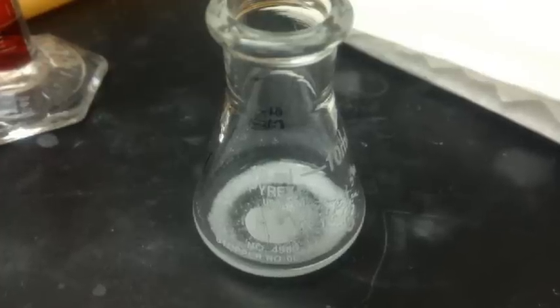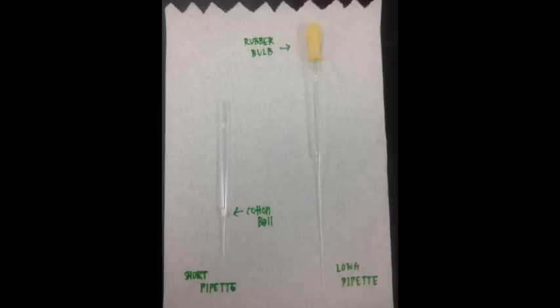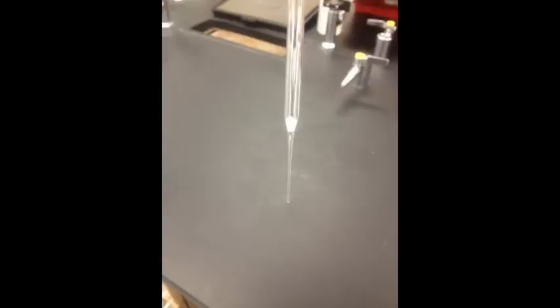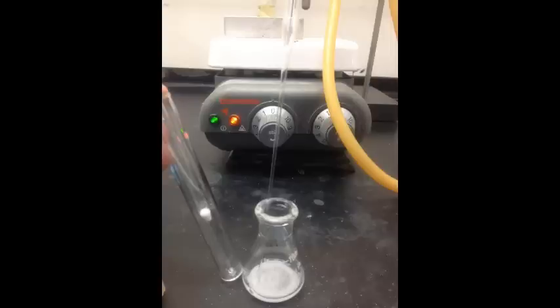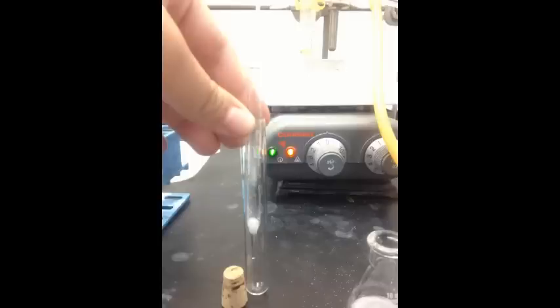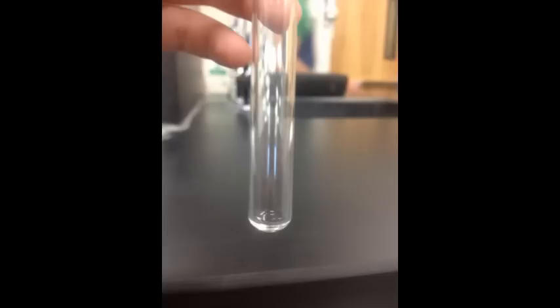When the content is completely dried, we use a short pipette with cotton ball and long pipette with rubber ball on top to filter the dried content into the test tube while excluding anhydrous sodium sulfate, and only collecting the product. This is a test tube with the collected product, and it's further analyzed using IR.